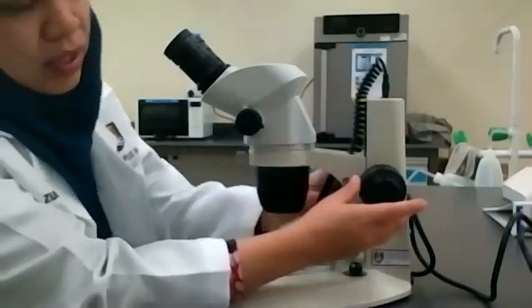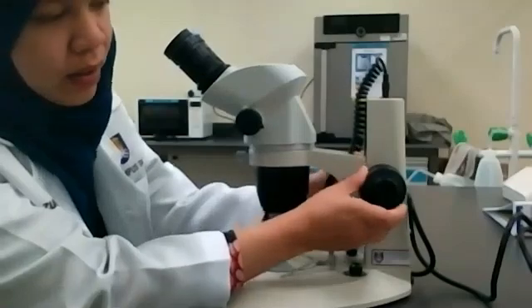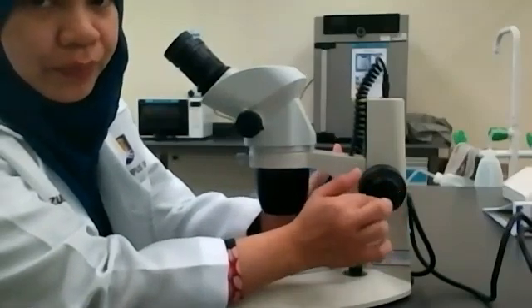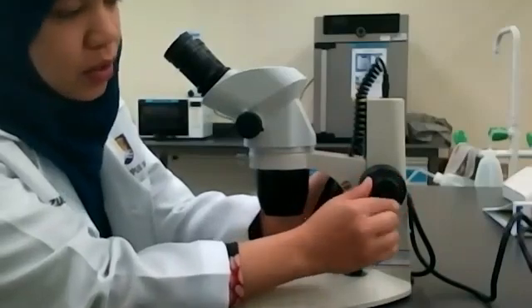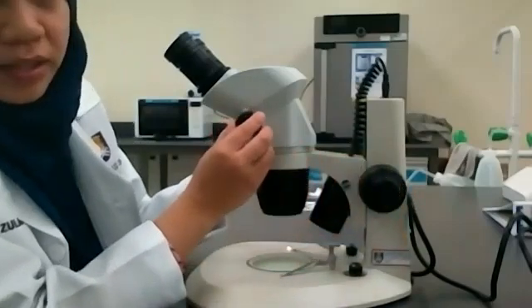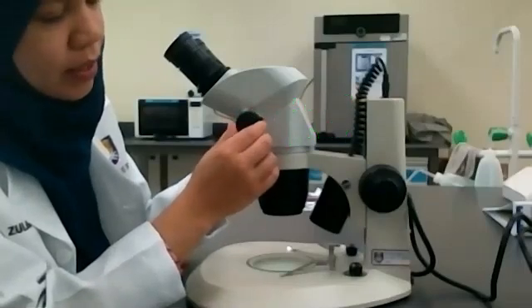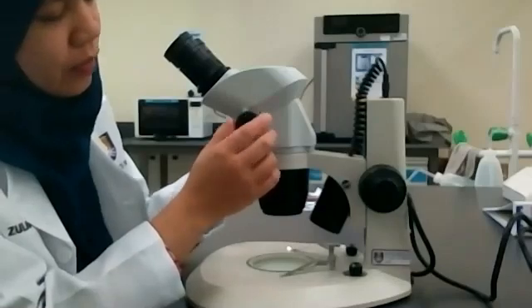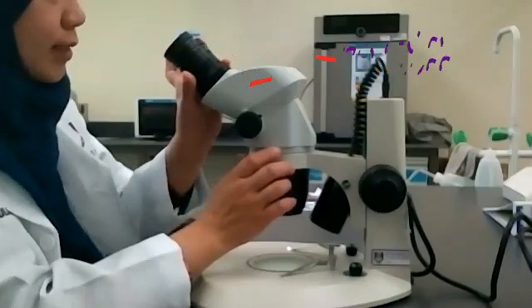Next would be the coarse adjustment knob, the bigger knob. And the fine focus adjustment knob, to focus the image for more details. And then this is zoom, whereby it helps to zoom the parts or the structure of the specimen. And this is the ocular lens.